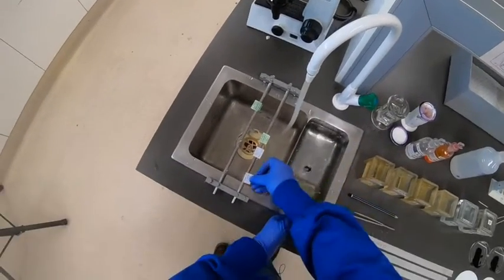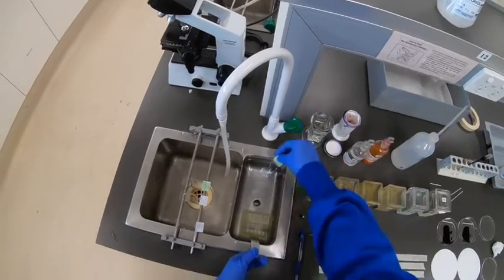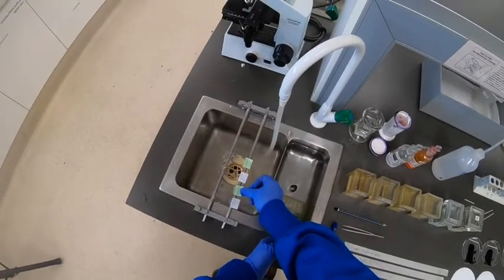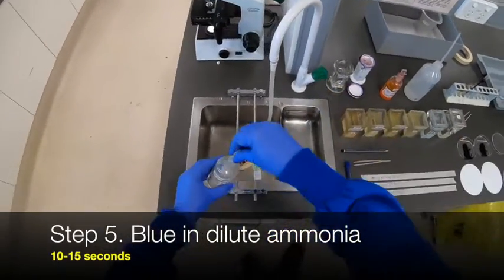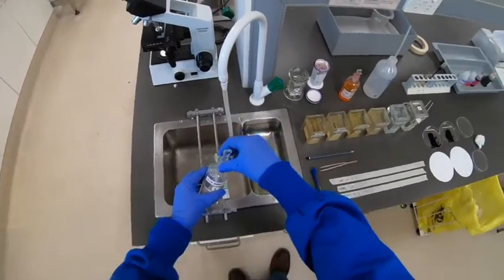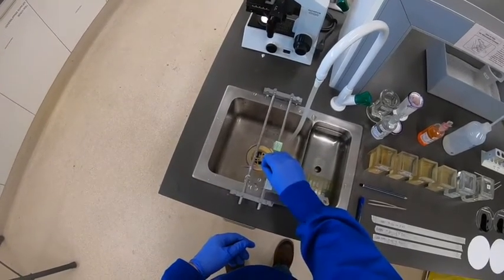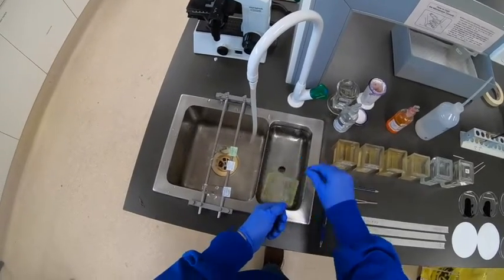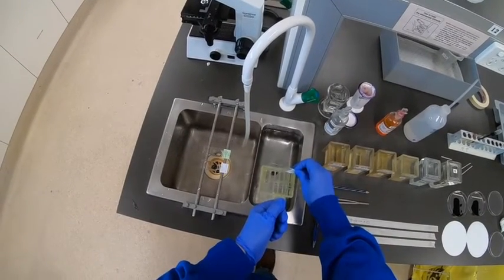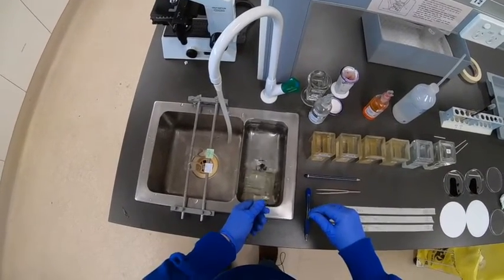That's quite critical — only one dip. If we do more than that, even despite its resistance to acidic conditions, we'll lose too much of it when it goes into the Van Gieson solution. So one dip and one dip only. I won't even bother with microscope control here because I can see the section has stained even without looking down the microscope, and since I physically can't do less than one dip, this is just about right. Still blue it with dilute ammonia — that's essential to bring out a very dark, almost black colour — then rinse that off in the water bath.